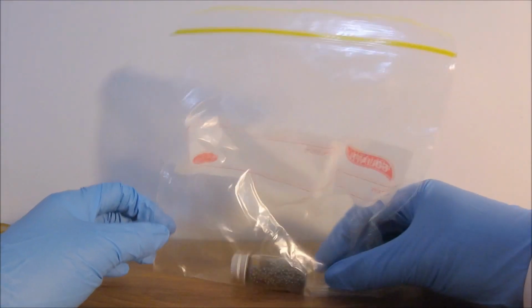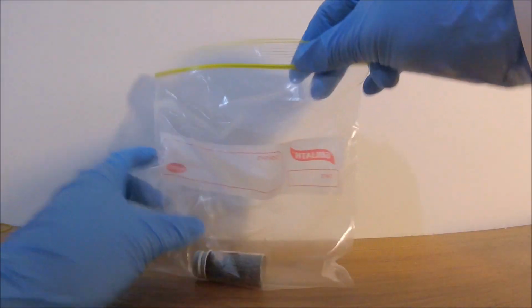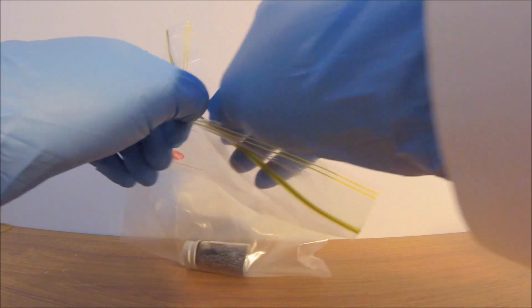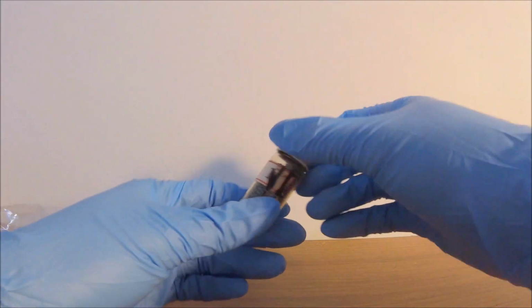Good night, mate. Recently, I was thinking about revisiting the touch powder project I did about a year ago. But when I went to check the chemicals, this is what happened. Usually I don't show failure videos, but this one is rather interesting.